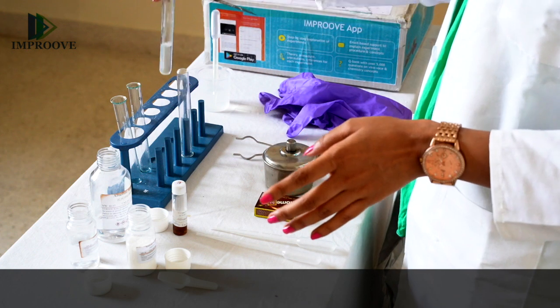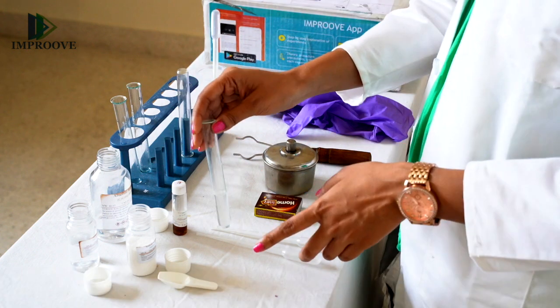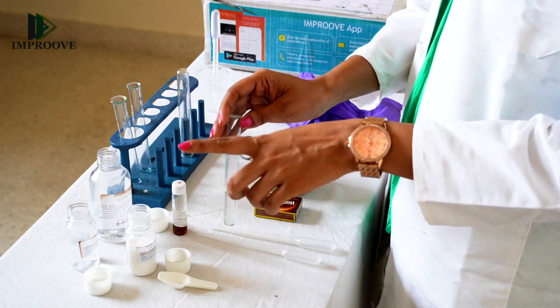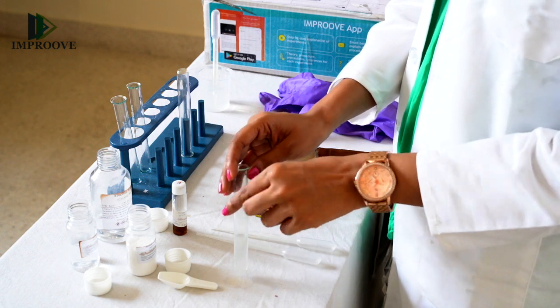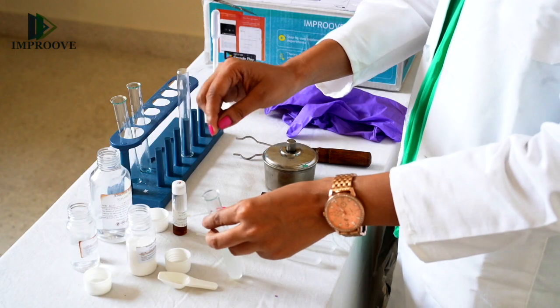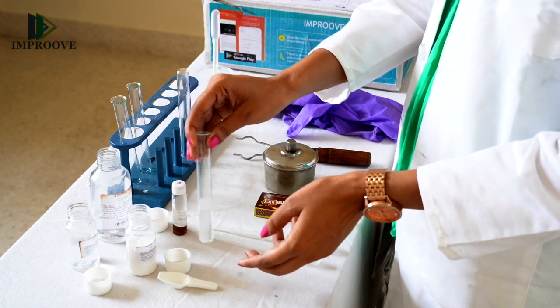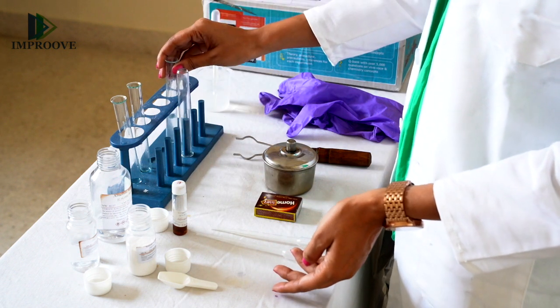Initially, take a clean and dry test tube and prepare an aqueous solution of sodium hydrogen carbonate. Take about one gram of sodium bicarbonate and add to it about 5 ml of water and mix it well. Your aqueous solution is ready.